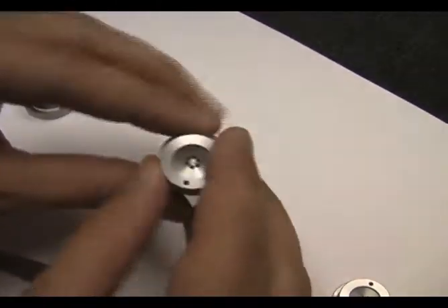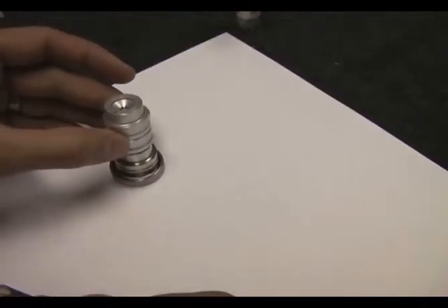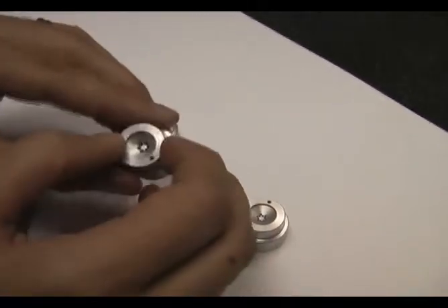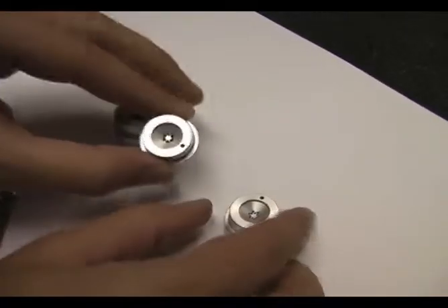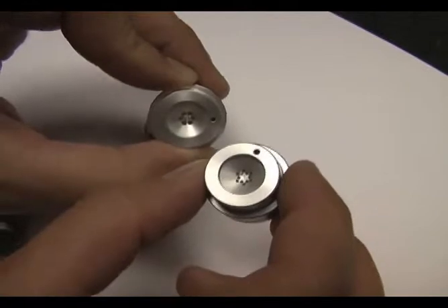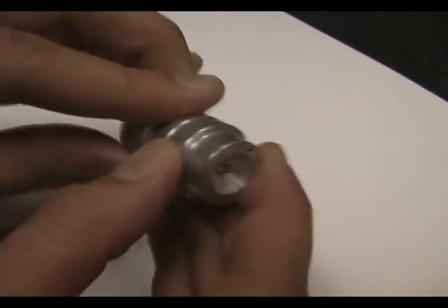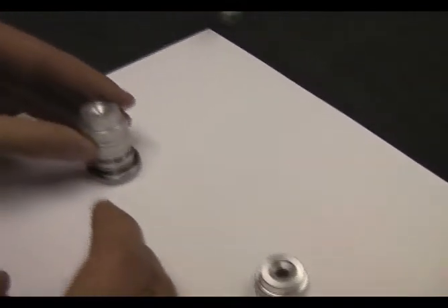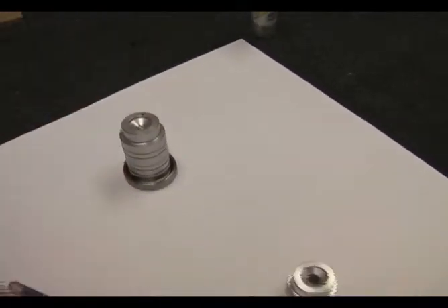The medium one goes on top and this goes on top. For most small pharmaceutical powders, you'll want to use the medium nozzle and the small nozzle. It sits right on top.